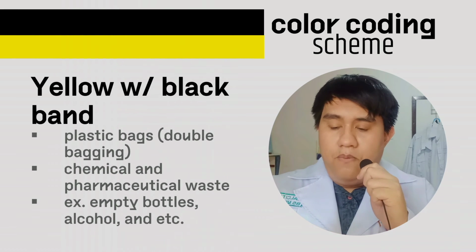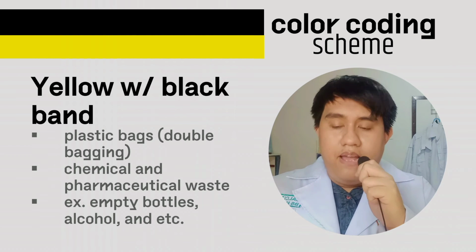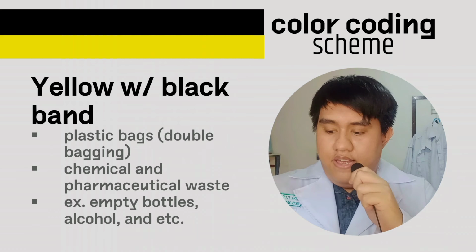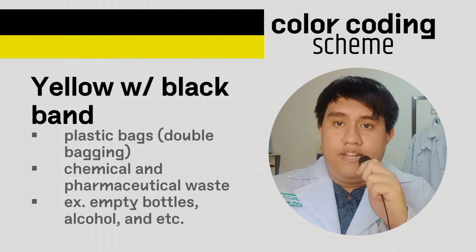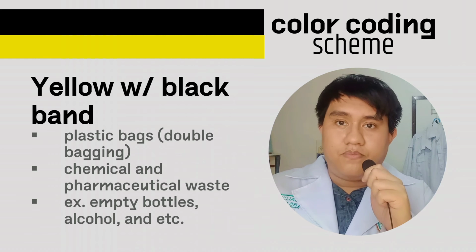Next, we have the yellow bag with black band. This has examples like empty bottles, containers of betadine, alcohol, and etc. That's why it's also called the chemical and pharmaceutical waste.